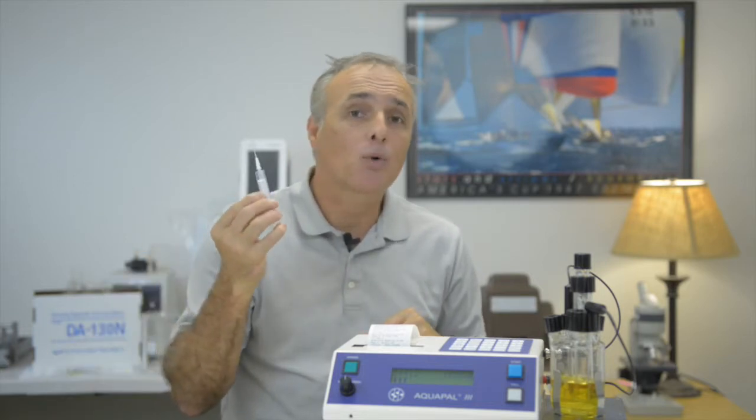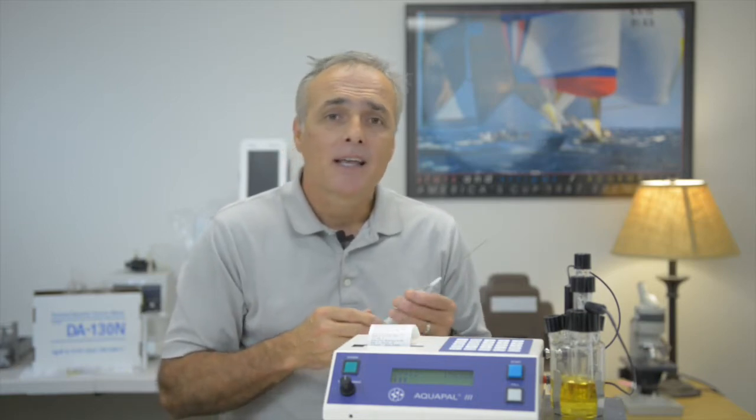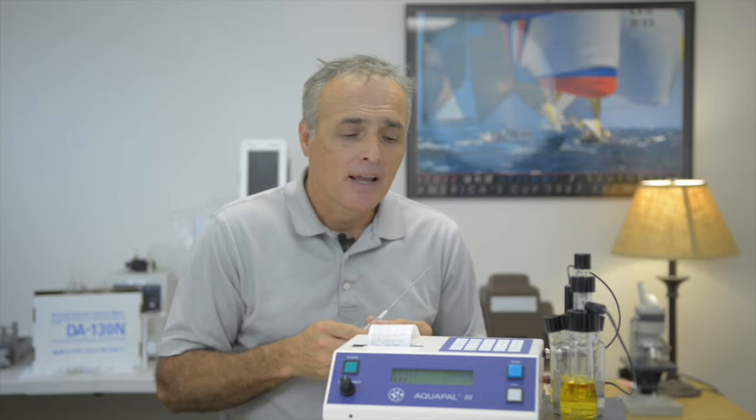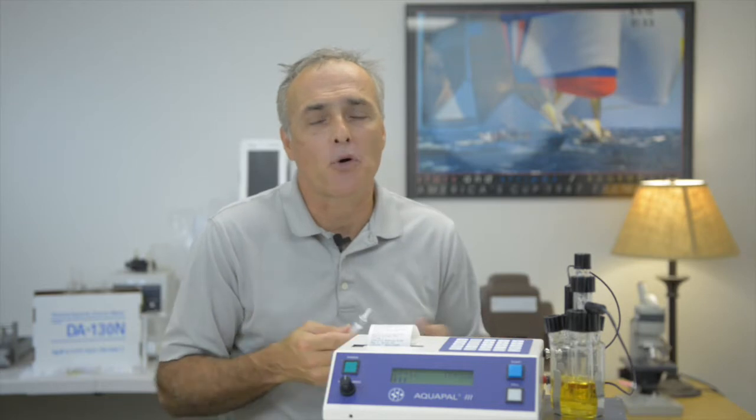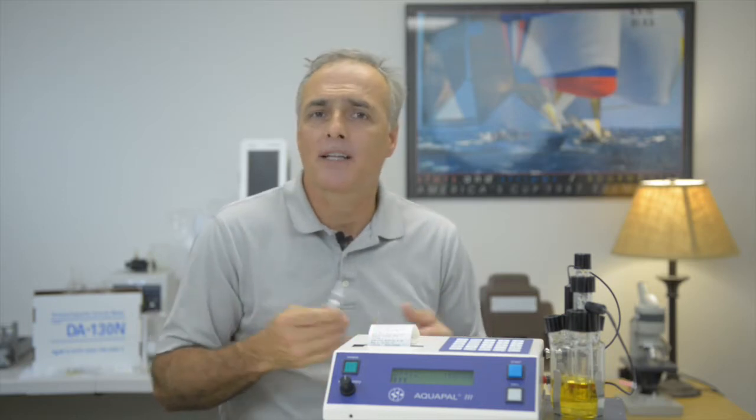Specific gravity is another way for us to find weight. It's based on density. If we think about water, the specific gravity of water at 4 degrees C is, at that point, 1 milliliter of a sample is equal to 1 gram by weight. So if you have a specific gravity of, say, 0.86, the math behind it is basically you're getting a weight of a volume, and in this case 0.86 grams. So it's a way of getting a weight of something using a volume rather than a balance. A lot of organizations use specific gravity because it's one less instrument that they have to have.